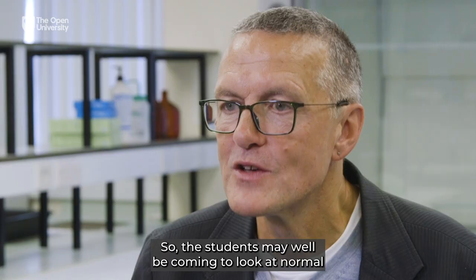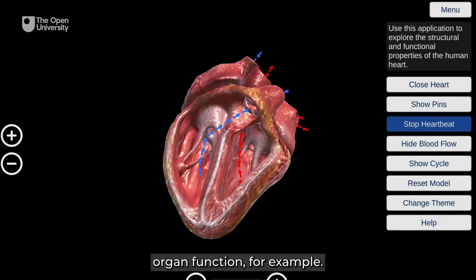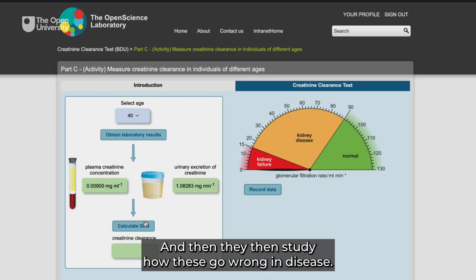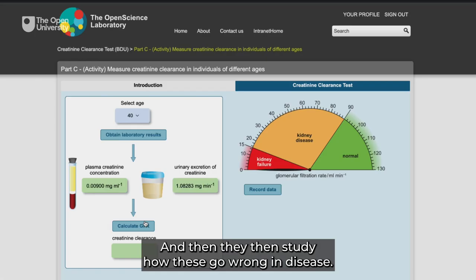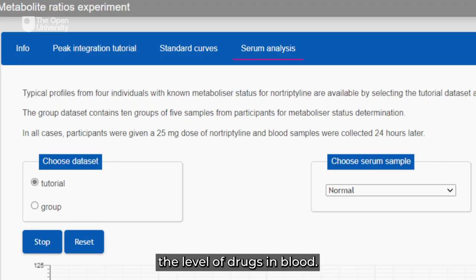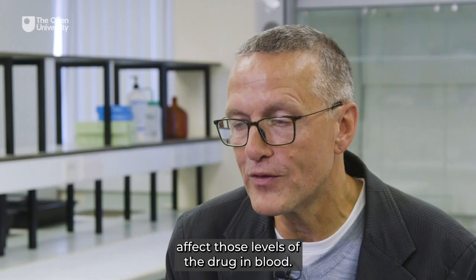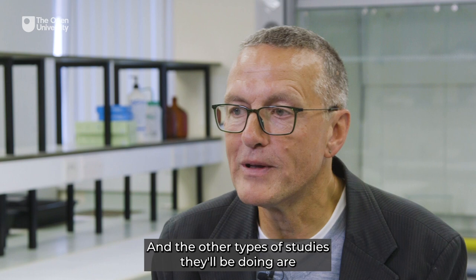So what kind of activities do the students do? So the students may well be coming to look at normal organ function, for example looking at hearts or lungs or kidney function, and then they study how these go wrong in disease. They may also be coming to do quantitative work, so measuring molecules. They'll for example be measuring the level of drugs in blood and then looking at how different genetics affect those levels of the drug in blood. The other types of studies they'll be doing are looking at large data sets.